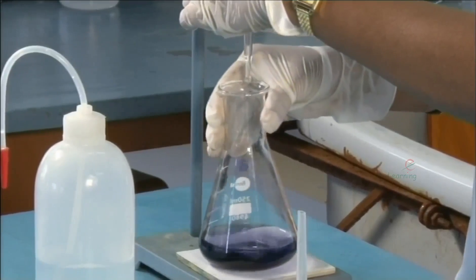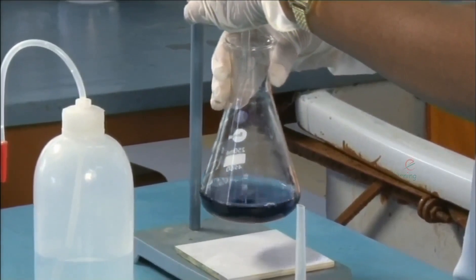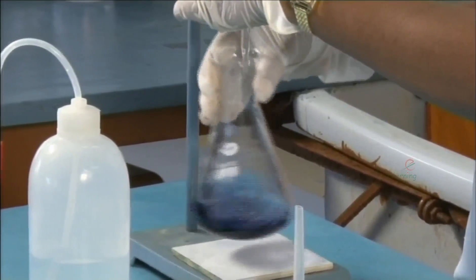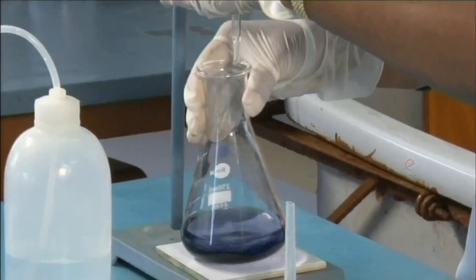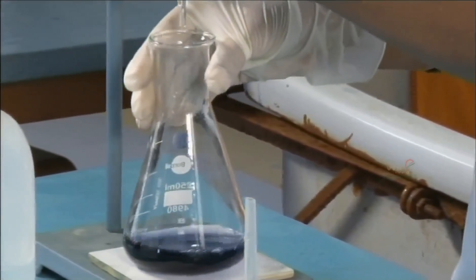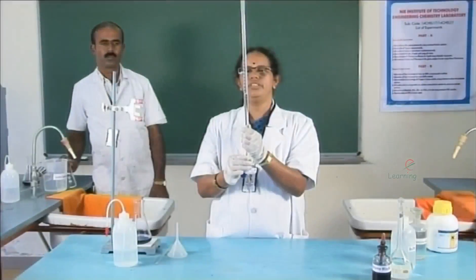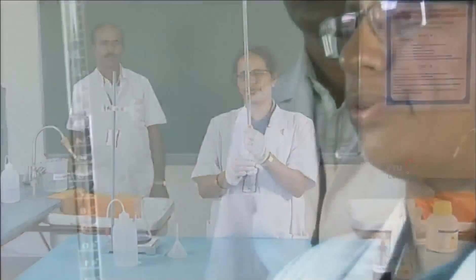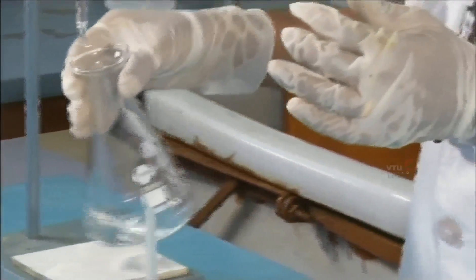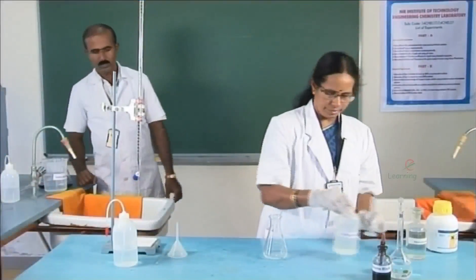Now the clear blue colour is obtained. The second reading is 32.4.